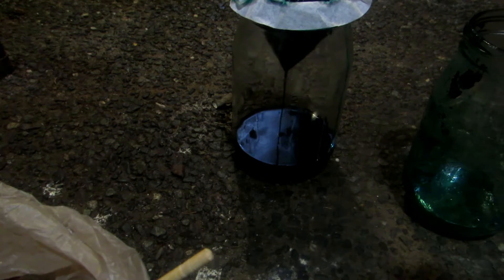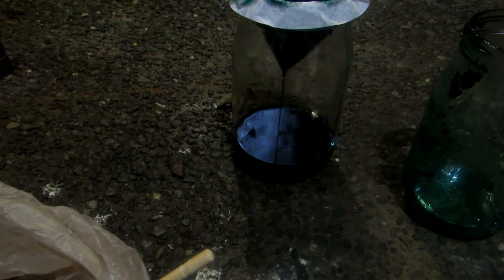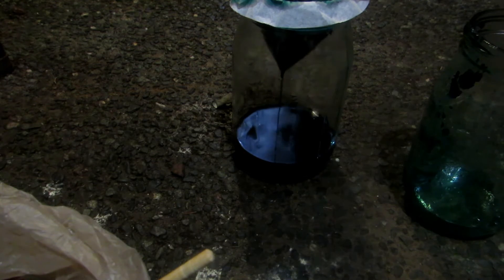You must properly dispose of waste cobalt chloride. It can be neutralized with aluminum foil, which produces aluminum chloride and cobalt metal — that's actually how I got cobalt metal in my other video. This gets rid of the toxic cobalt chloride. Next, we need to create a saturated solution of sodium hydroxide, which you can buy as drain cleaner. I got about six pounds at Home Hardware.